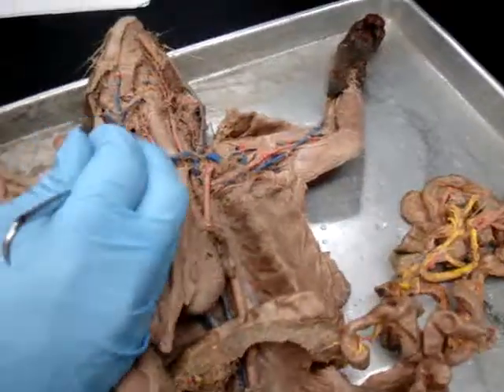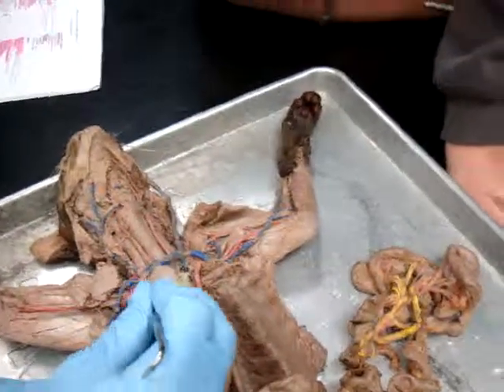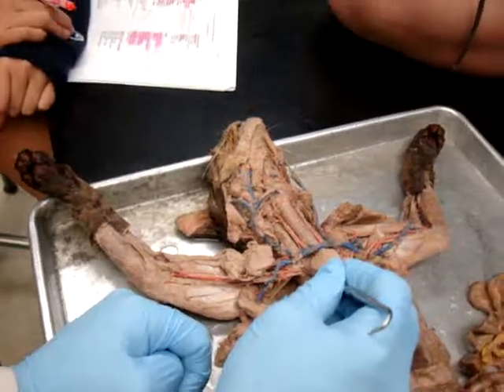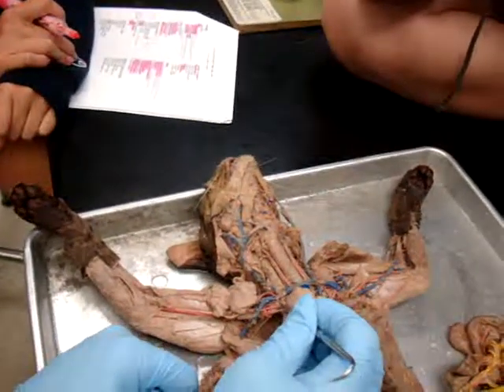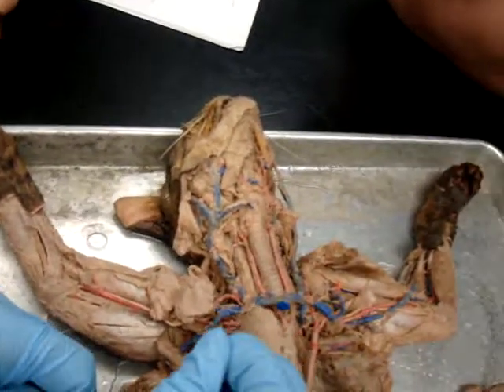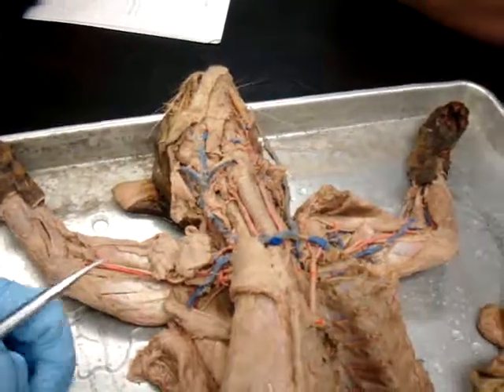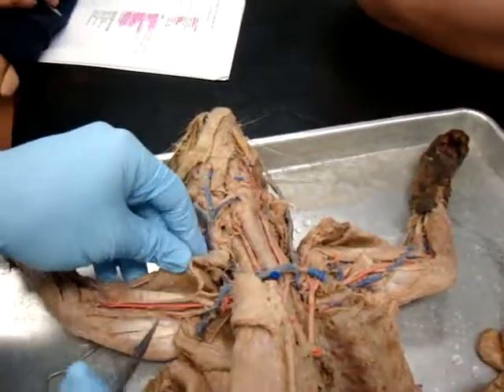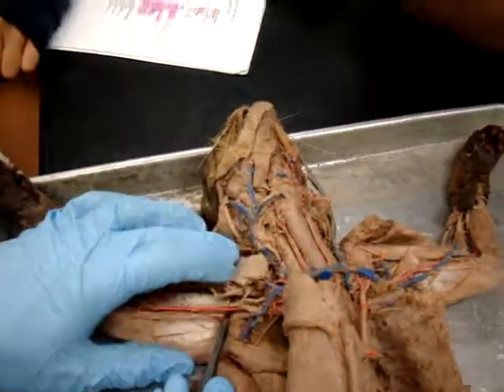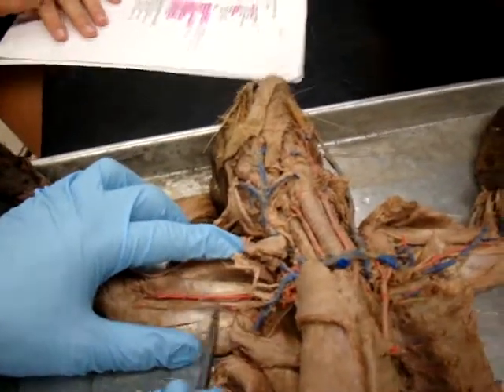So, moving out along the subclavian, we come to the border of the first rib, which is right here, because you can see the chest wall. At the border of the first rib, we change over to axillary. So this is now the blood vessel in the armpit, and axillary is going to be right there. Now, the borderline that we are going to use in this class is the surgical head of the humerus, which should be right about there. And then it switches to brachial. Now we switch from axillary to brachial.